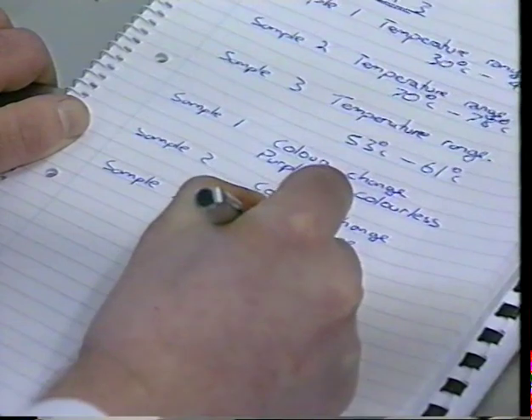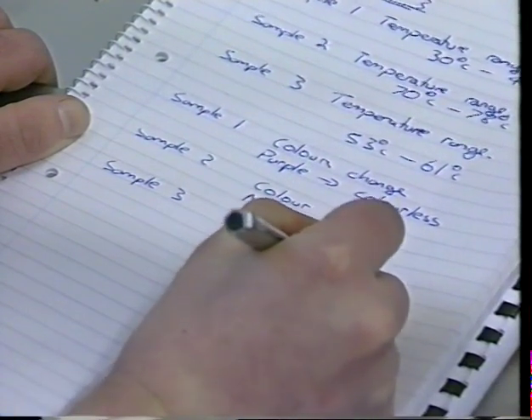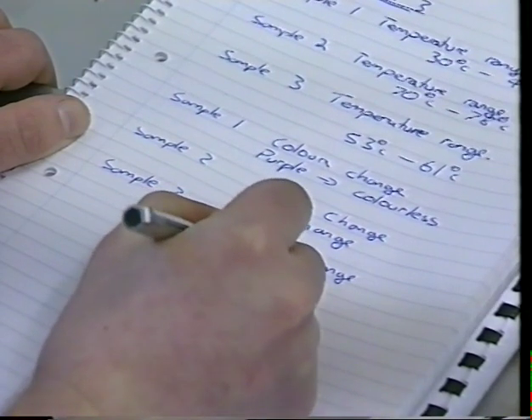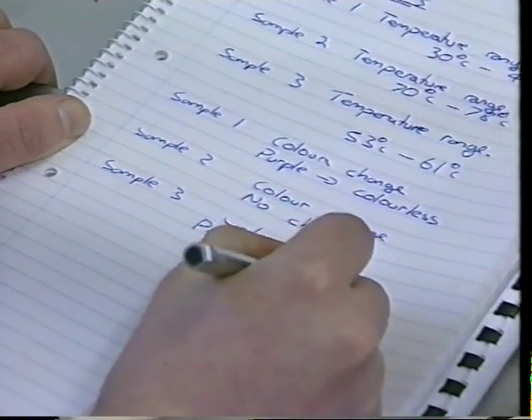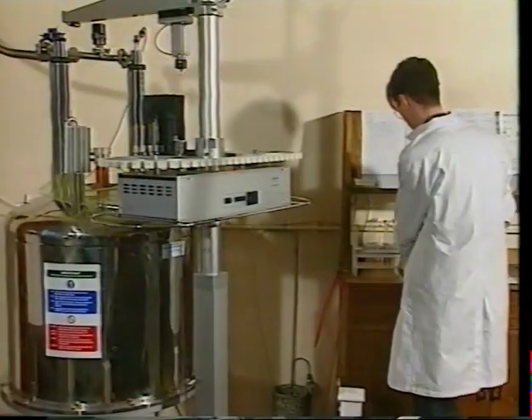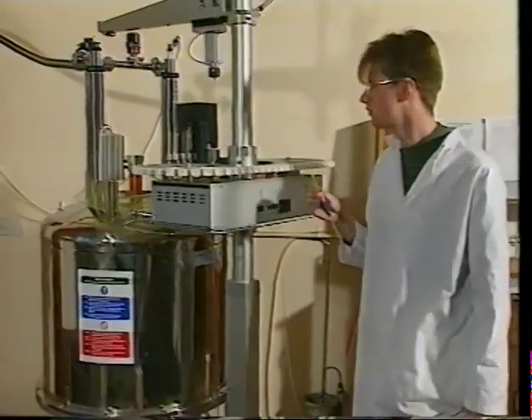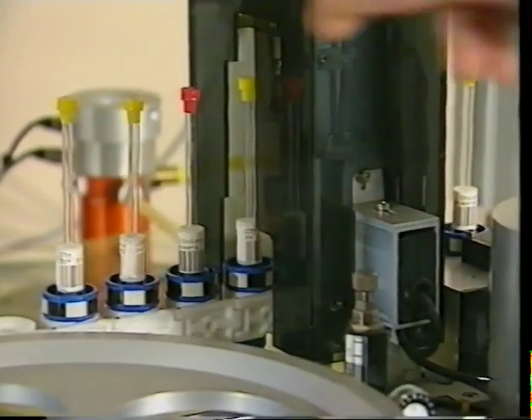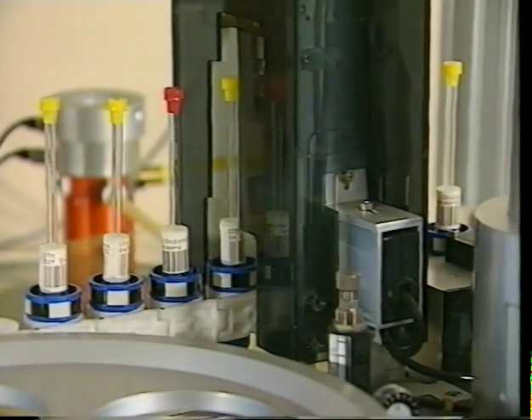As well as being destructive, these tests can only give us a guide to the functional groups present in any compound. But modern science now demands much more detailed information about chemical structures. Nuclear magnetic resonance spectroscopy, or NMR, offers us a valuable means of obtaining the detailed information that's now required of us.